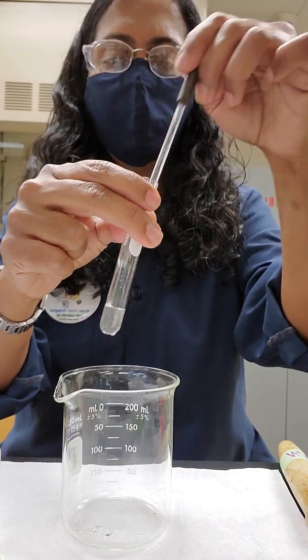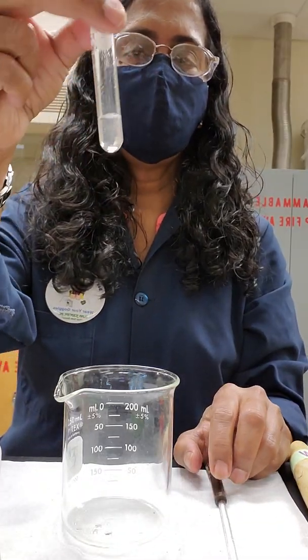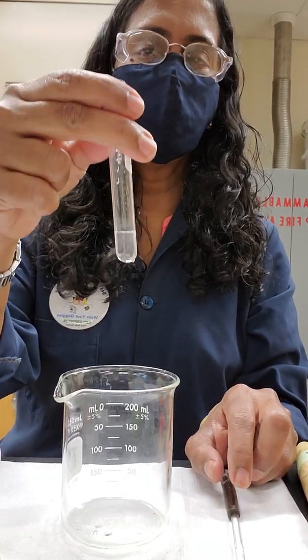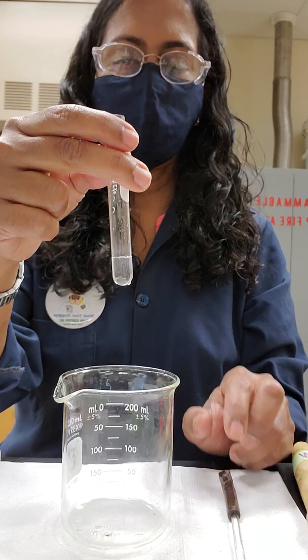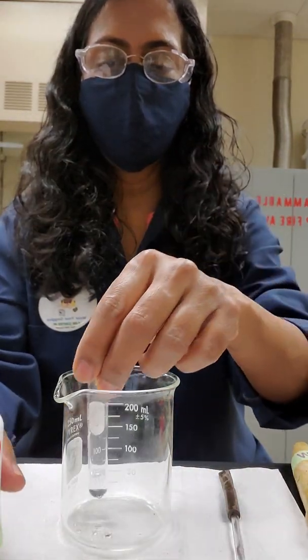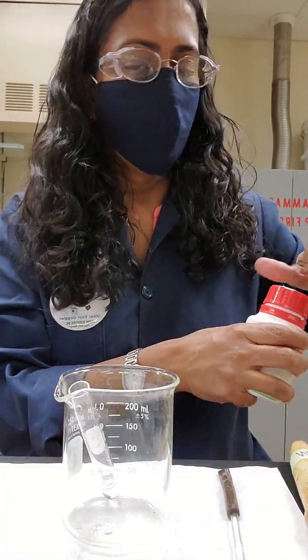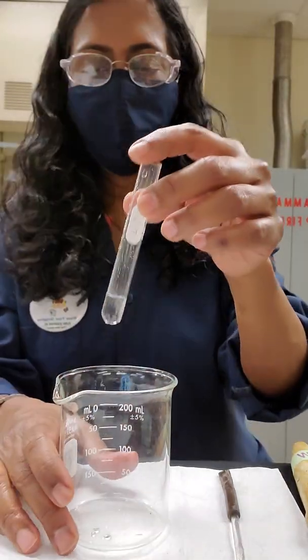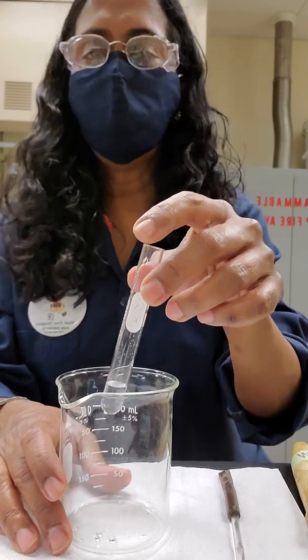So basically, you don't see any color here, so this color is called colorless, so you need to record that, and I'll let you decide on the rest of the colors in the experiment. So this is a solution of sodium bromide. That is the first part of part three.